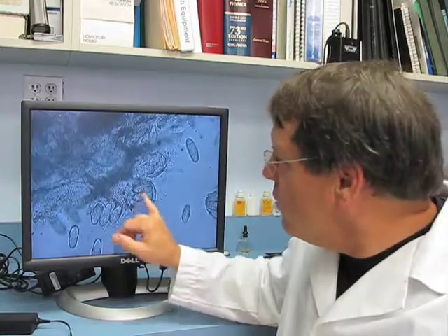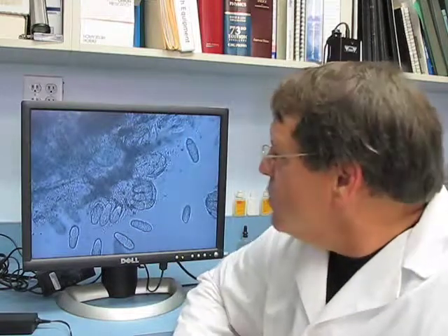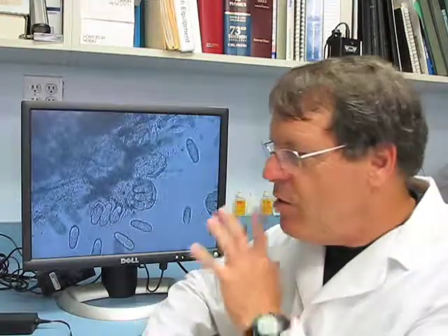So that's it for the diagnosis of Leptosphaerulina trifolii, and you can see the sacs that are around the spores, and you have the characteristic types of spores. Probably won't need to really understand this fungus very well because it attacks plants that are pretty much dead anyway. But this is one that can be easily confused with anthracnose. Main thing that you'll see is that this one will hardly ever be on green tissue. It's mostly attacking more or less senescent tissue, in a necrotrophic type of pathogenic state. That's about it for now.